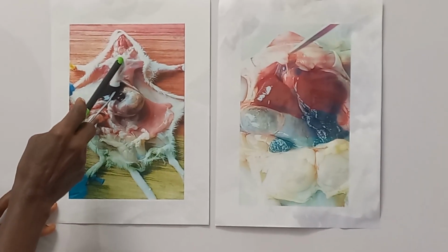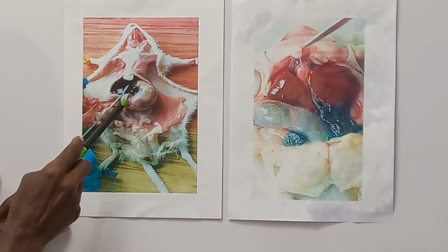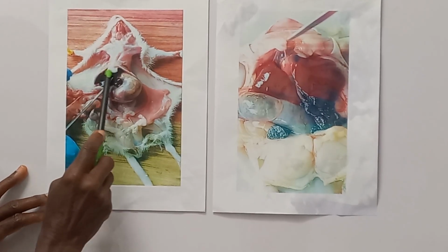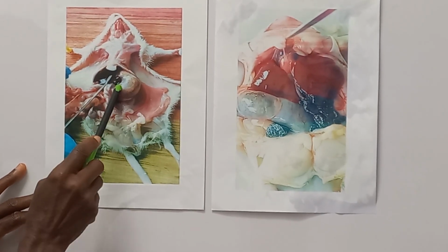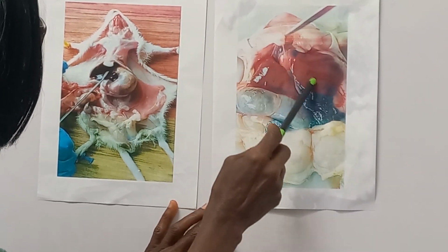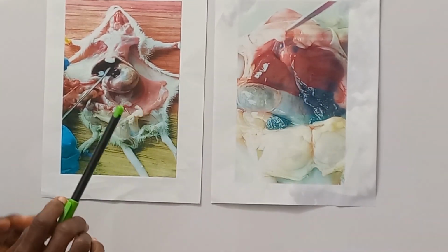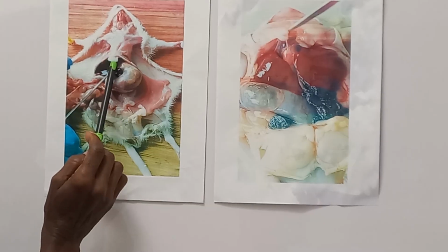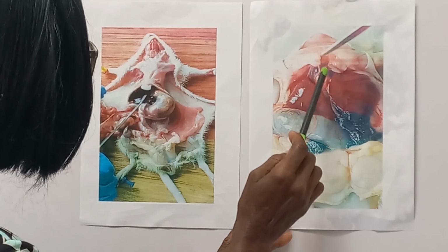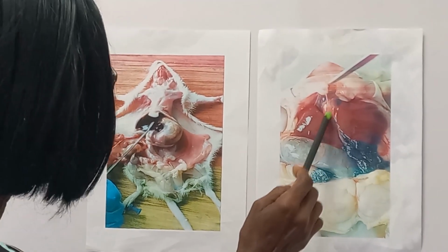Now, look at the difference between the thoracic cavity and the abdominopelvic cavity of the mammal. They are separated. Here is the thoracic cavity. Here is the abdominopelvic cavity of the mammal. In the amphibian, the toad, the thoracic cavity and the abdominopelvic cavity are one large cavity. There's no diaphragm that separates it. This one has a diaphragm. Here is the xiphoid cartilage, the diaphragm here. Here, there's no diaphragm to separate the abdominal cavity from the thoracic cavity.